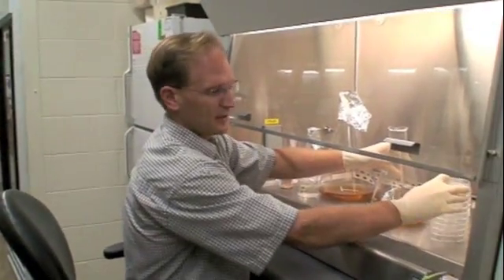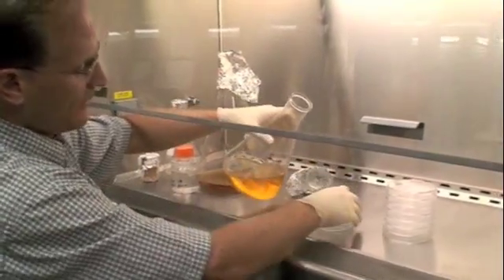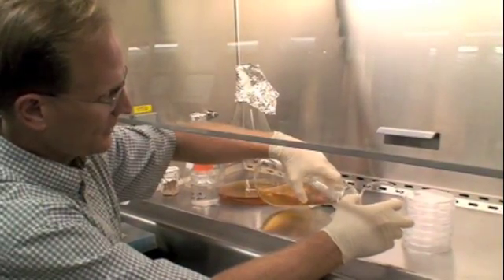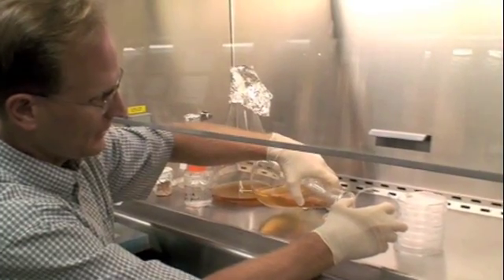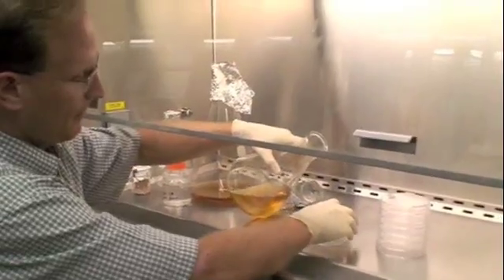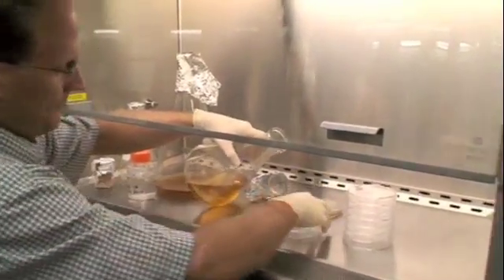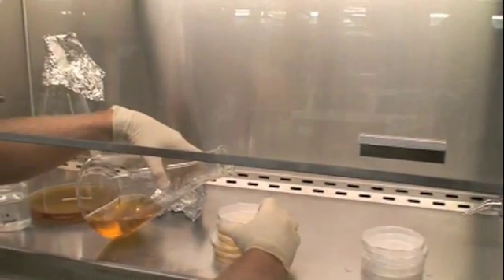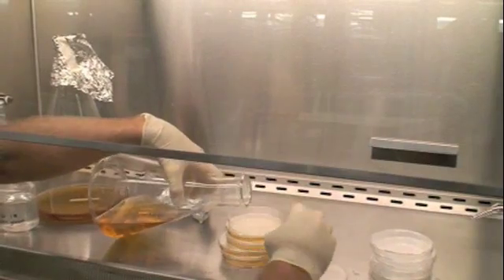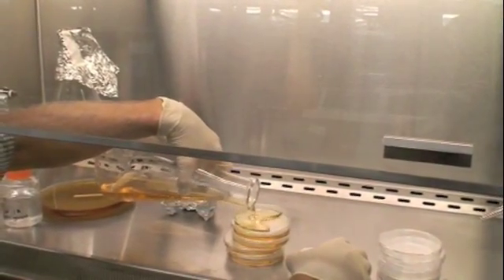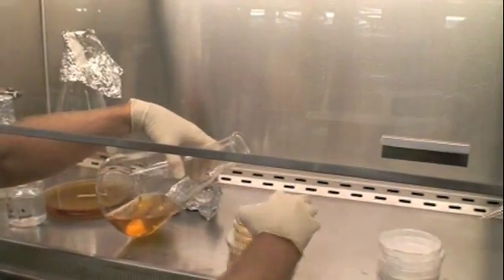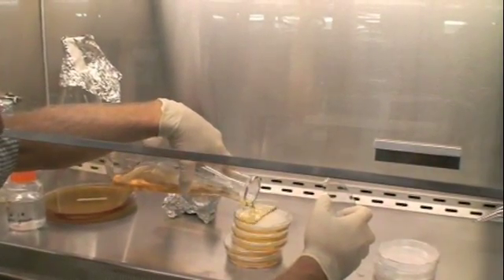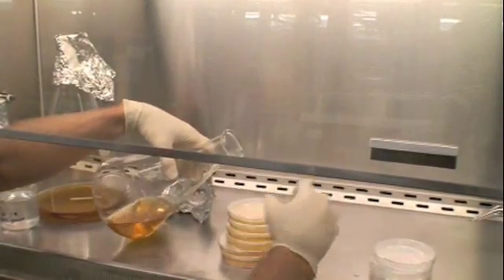Now if you look closely here, the plates are upside down. In general, you want to have about 20 milliliters per plate and fill it up. I'm being generous here because I know we've got more media than we need. It's better to start on the bottom. So I'm just looking at the side of the plate and I want to have it about halfway full. And you notice that I have put bubbles in this as I was shaking it. Those bubbles can be confused for colonies later on.